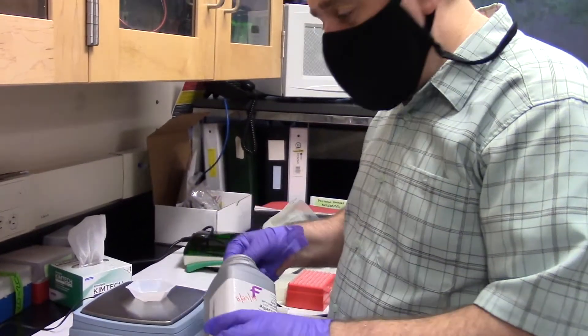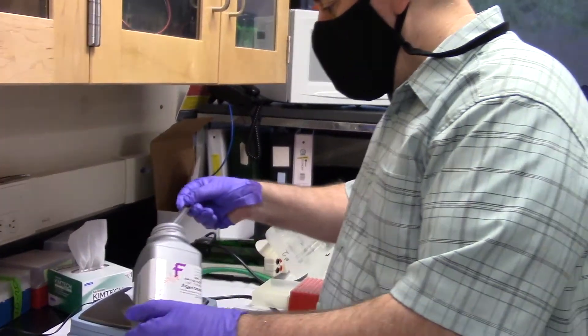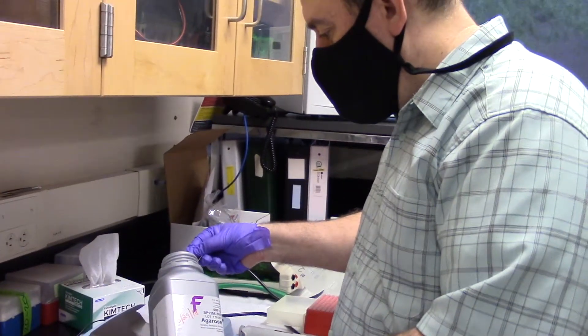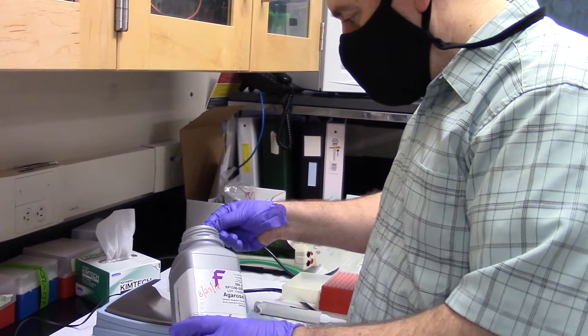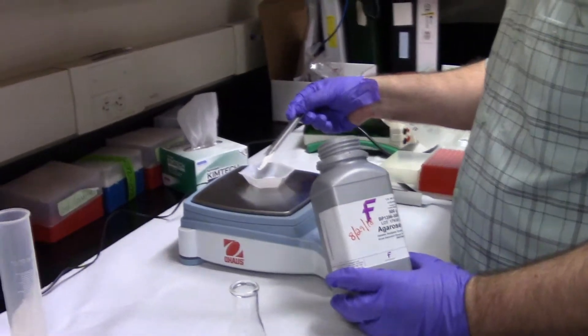I want 0.8 grams. Halfway there. A little more than I want. 5, 6, 7.